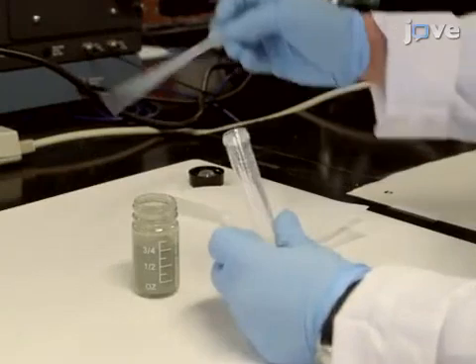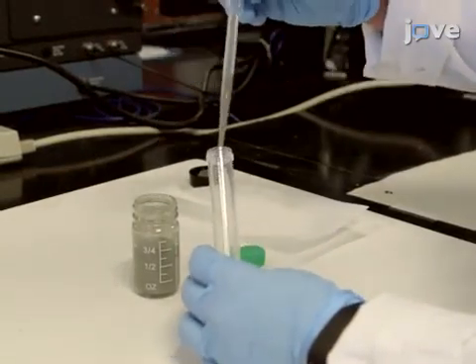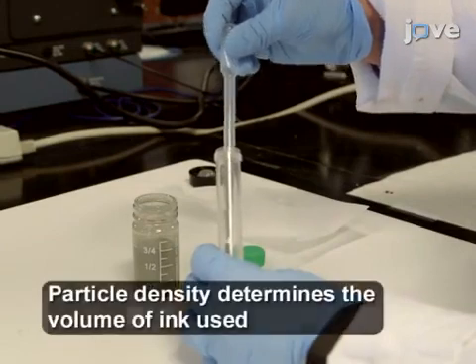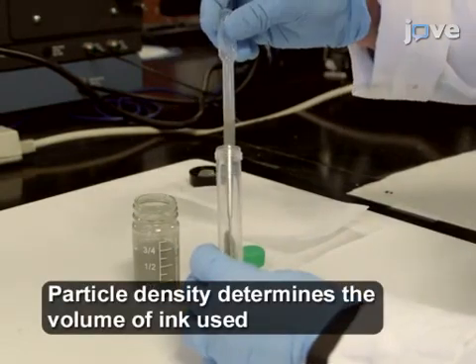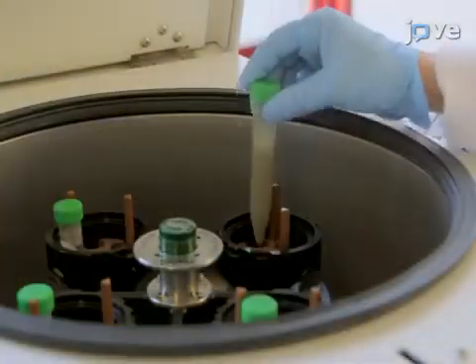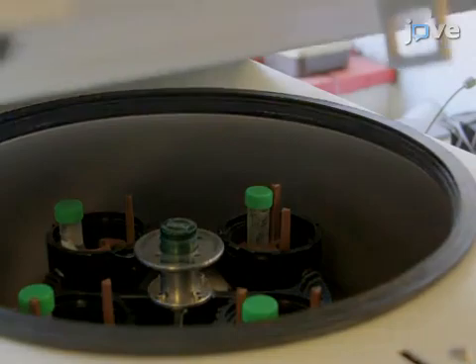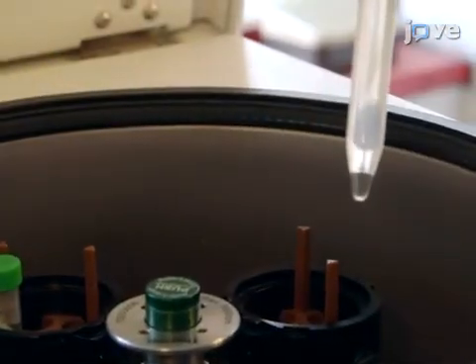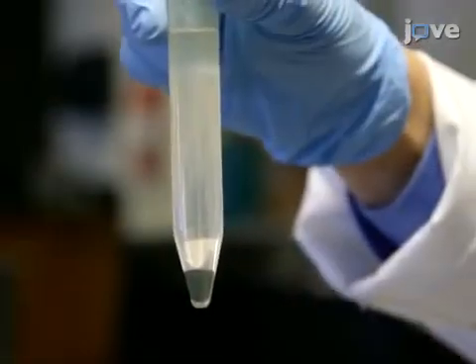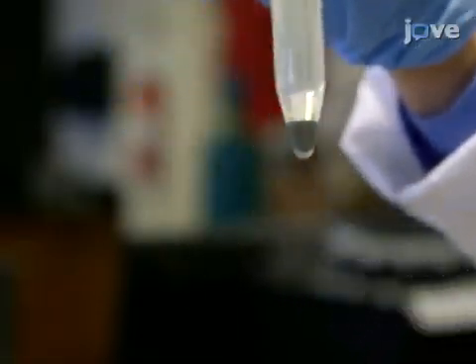To isolate surface functionalized particles from a colloidal dispersion, begin by pipetting enough ink into a fresh conical tube such that the total mass of the particles is at least two grams. Place the tube into a swinging bucket benchtop centrifuge and spin down the functionalized particles for 30 to 90 minutes at room temperature. For proper particle sedimentation, the spin speed should be optimized such that a clear, transparent supernatant is achieved within 90 minutes.